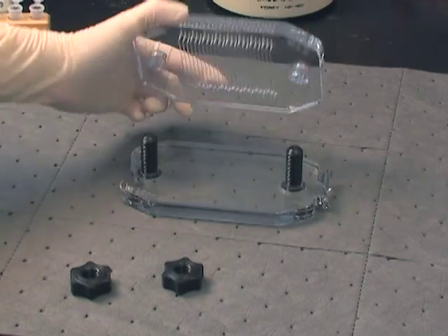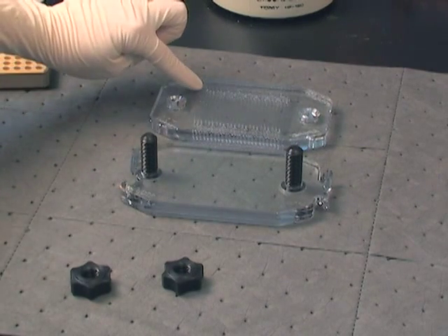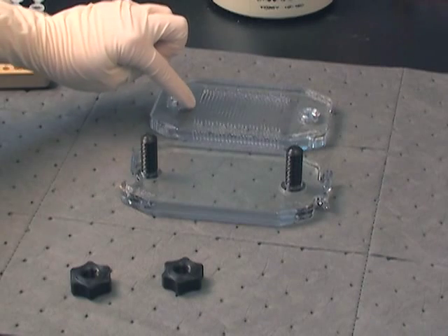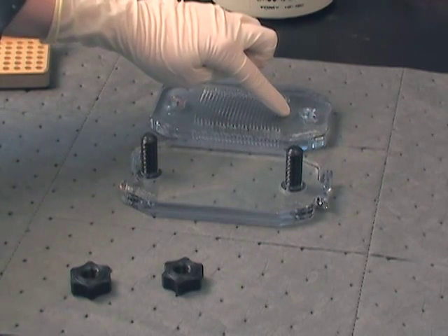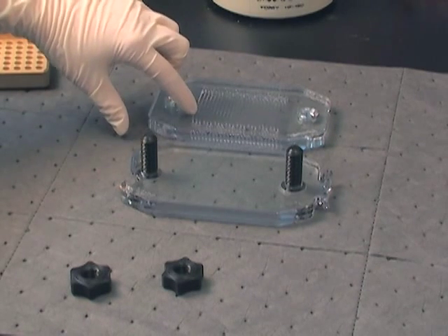To assemble the MPX for use, lift the top plate from the posts, flip it 180 degrees, and place face down on the bench top. The foam cushion provides a pliable backing which, when assembled, will seal the independent channels of the MPX.